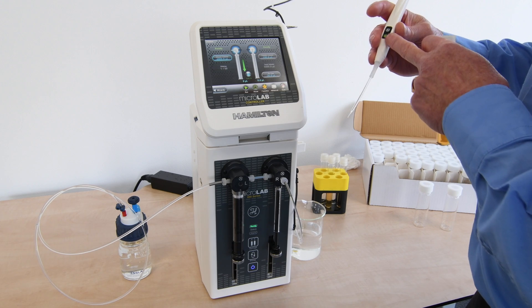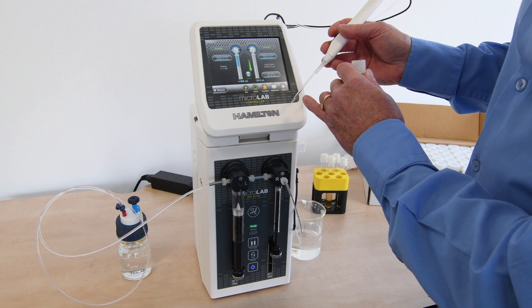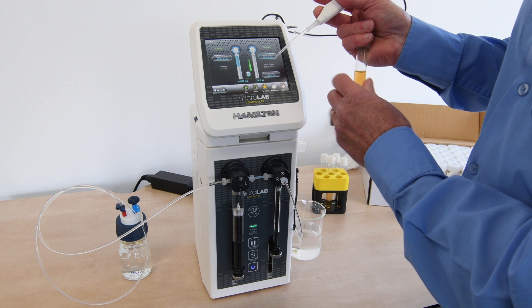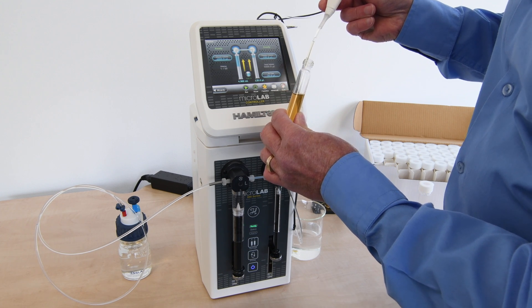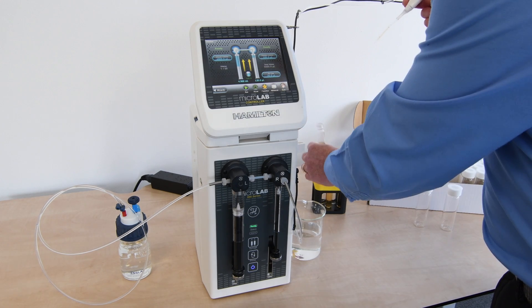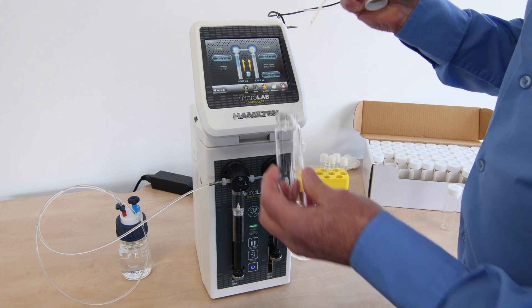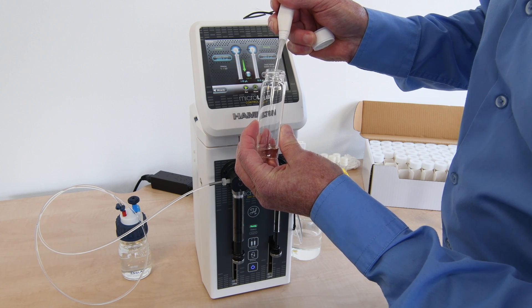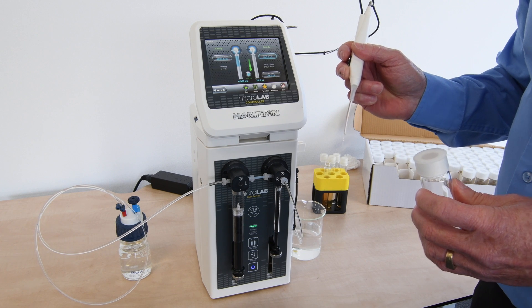By actuating, we can see the diluent volume highlighted in blue aspirates first. Then automatically, the 20 microliters air gap that I've input is drawn into the tubing line. We can now sample, and you can see the air gap that we've aspirated. The sample, diluent, and air gap can then be dispensed and mixed in the container.